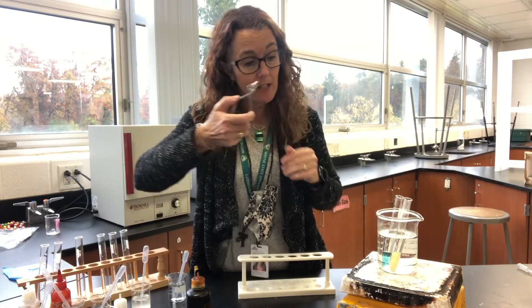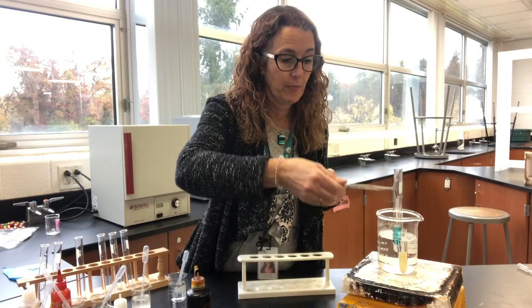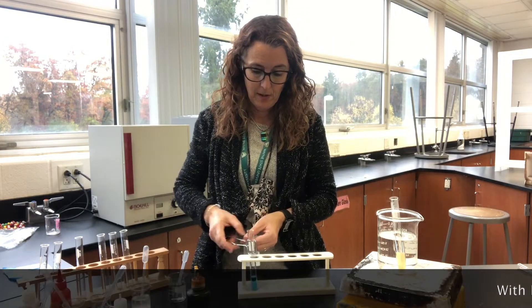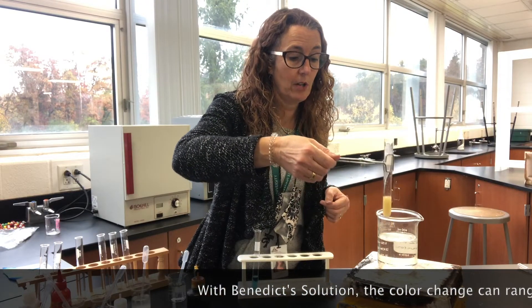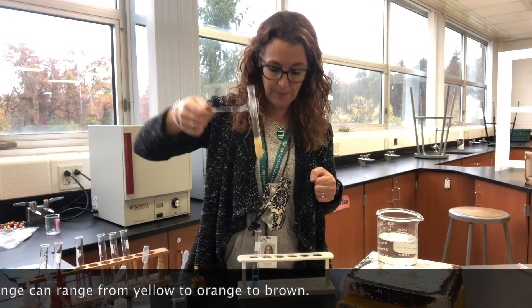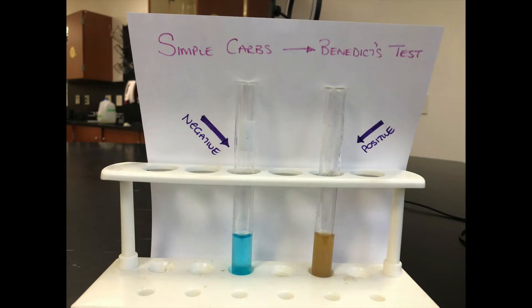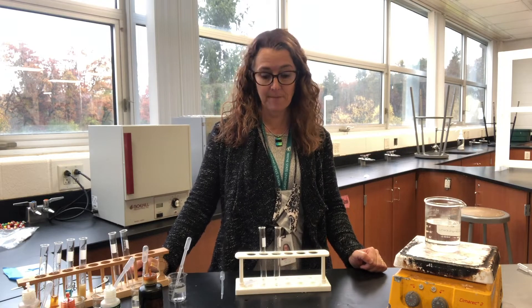I'm going to very carefully remove them using my tongs. The control with water is just the same blue color. But when I remove my simple sugar you can see there's a color change — this one has gone yellow. The change can go from anywhere from yellow through to a dark brown color with Benedict's solution in a simple sugar.